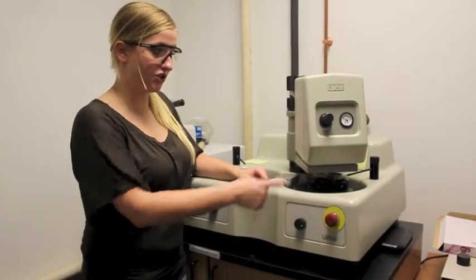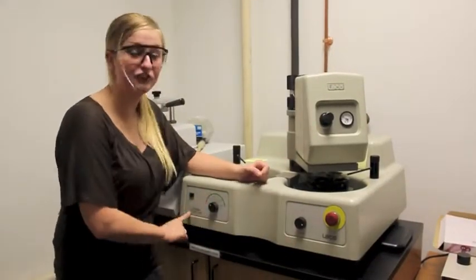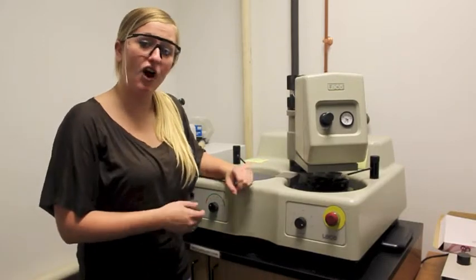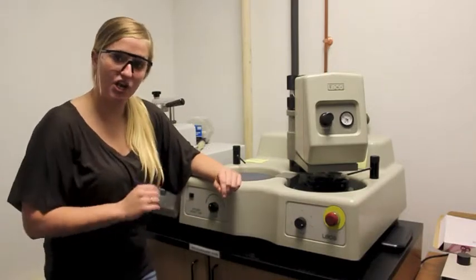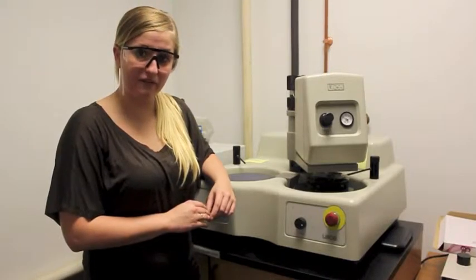Now, you will want to adjust your force, speed, and range as desired. For our example today, we are using a force of 22 pounds and a low range. Low range procedures are from 30 seconds to 3 minutes. High range procedures are anything above 4 minutes.